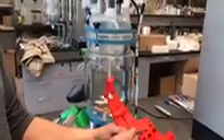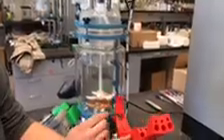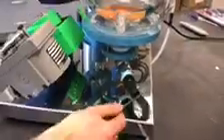The center tube here will come down through, it'll come through this angle and go to our diffusing ring, as you see down here. So this will be locked in two places, one with the temperature probe, and two, we actually cut a split here so it sets into this bottom dump valve. We oversized this valve so we can dump sludge right out of the bottom here.